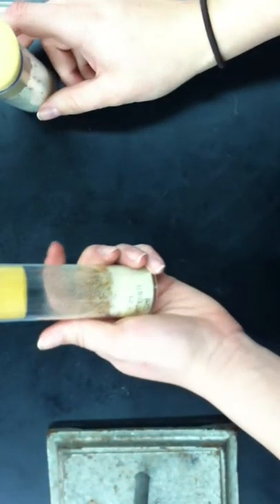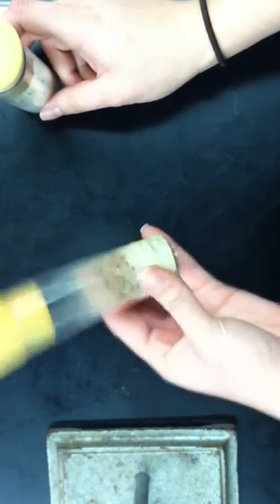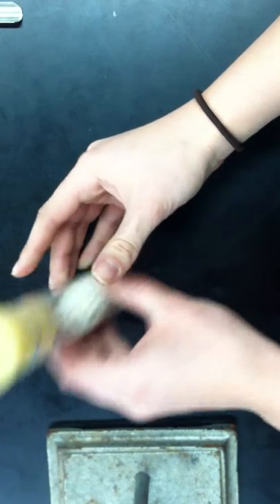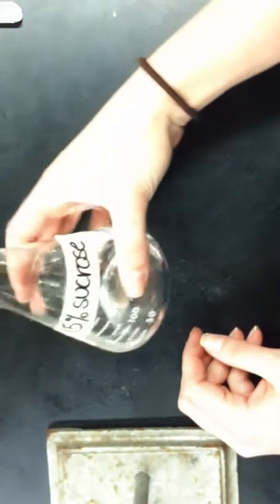First, you're going to need a fecund drosophila vial, followed by an empty vial. I already transferred the adults, but you're going to need to create another one to empty the adults into. A pre-made 15% sucrose solution, a sterile petri plate, a scoop, and a paintbrush.